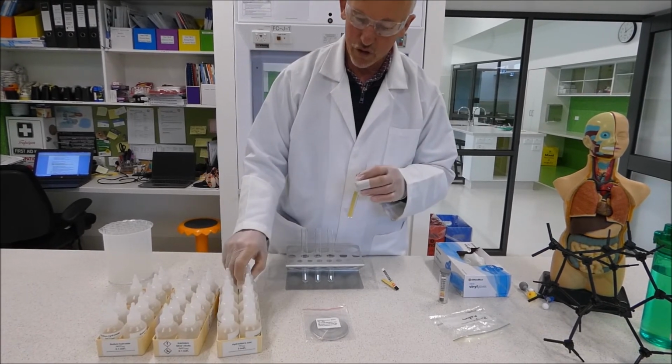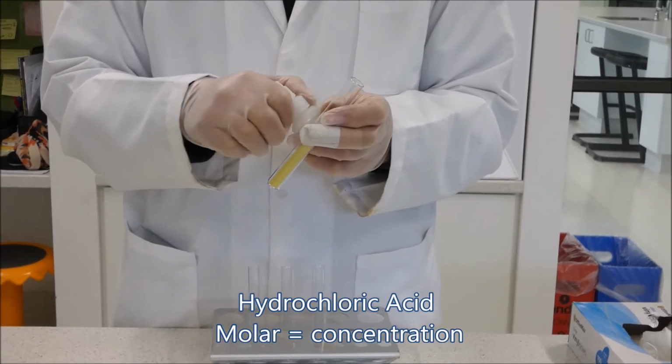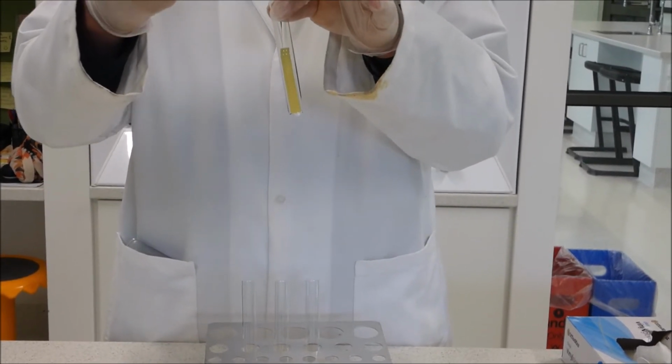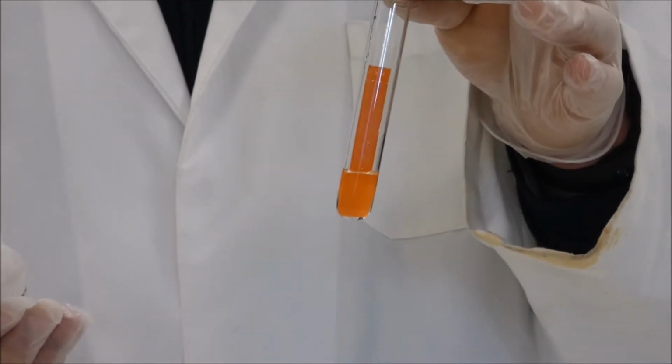We'll get some 2 molar hydrochloric acid. Now 2 molar simply means how strong the acid is. It means it has 2 moles, which is a bit complicated, but it means a certain number of atoms in each litre of solution. If we pour it in there, we'll see the colour change turns to a dark orange very, very quickly.